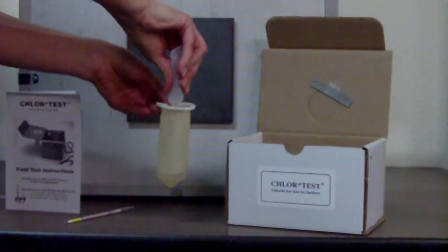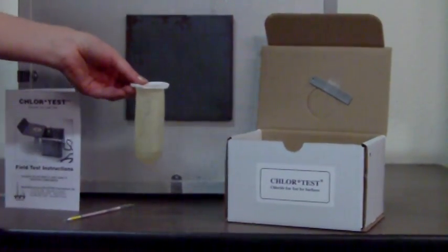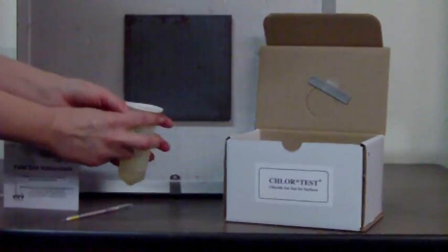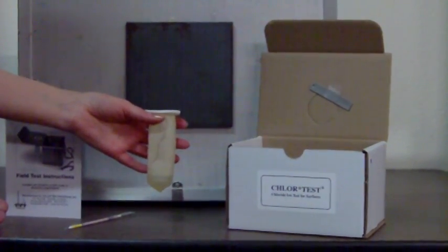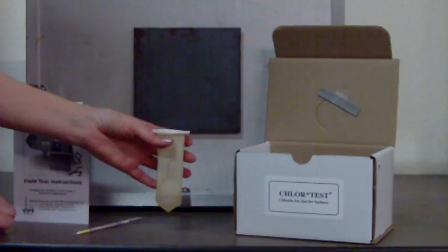Now the surface you're going to test on, make sure that it's clean and dry, that it doesn't have dust on it or particulate matter from abrasive blasting. We've got to have that adhesive seal form a liquid-tight seal on there, so it can't be dusty or it won't stick.